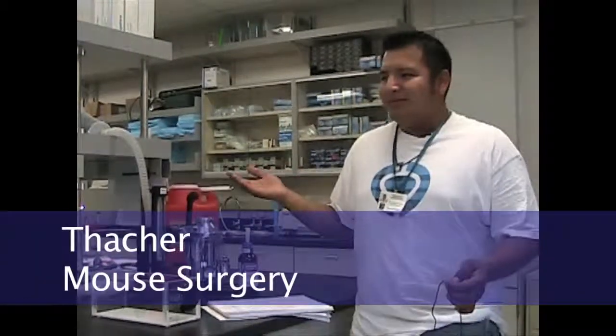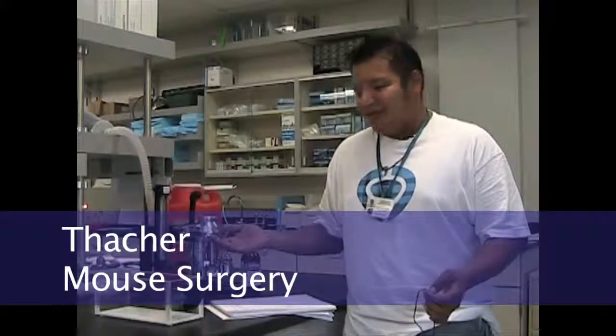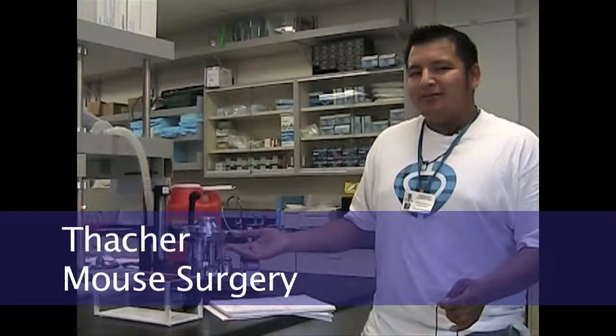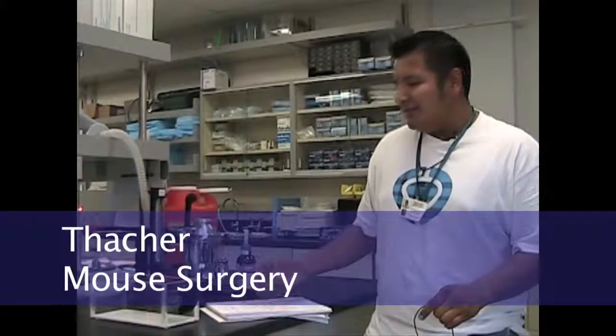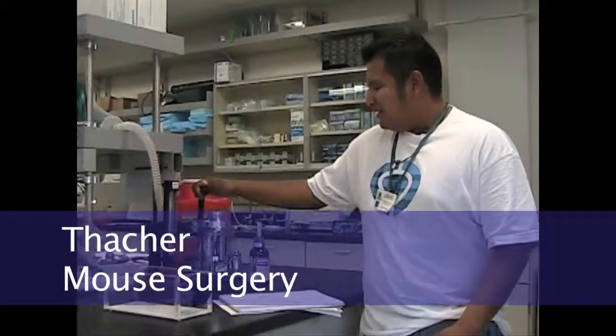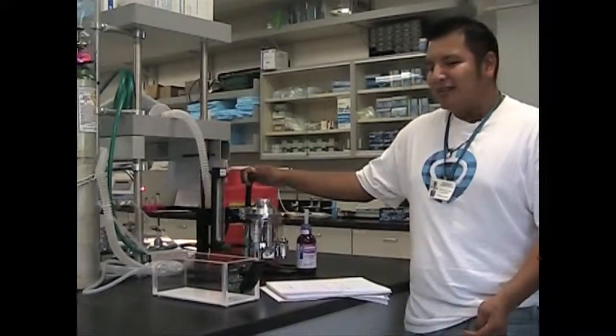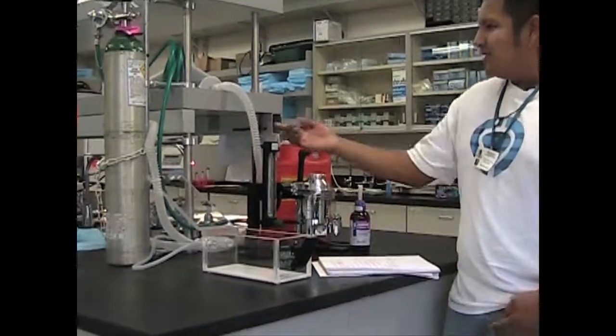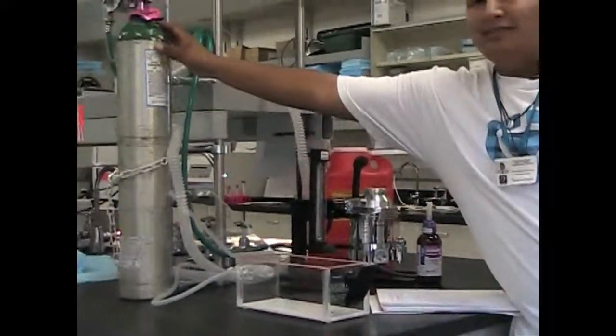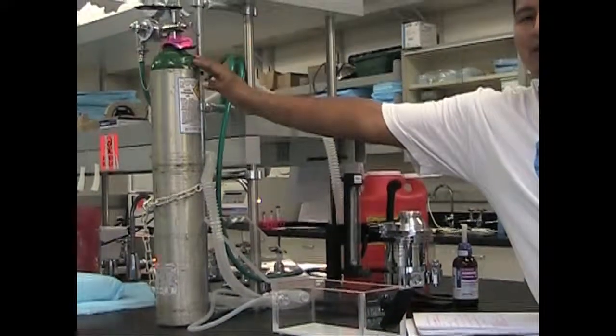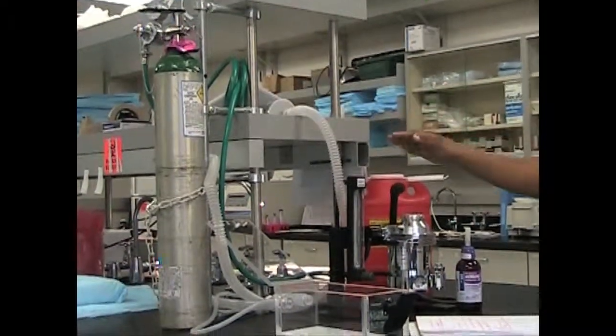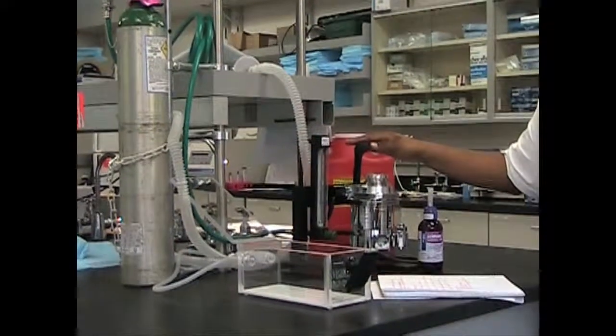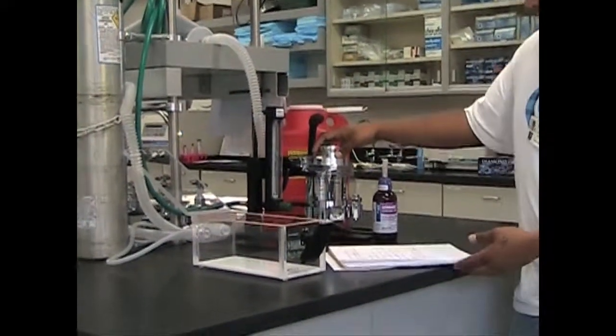My name is Dr. Valenzuela and this is the lab where I do my surgeries to study sleep deprivation following septic insult. This is an anesthesia machine which we use here in the lab. It's vaporized isoflurane hooked to an oxygen tank. The oxygen tank is the power source—without this you couldn't use the anesthesia machine.